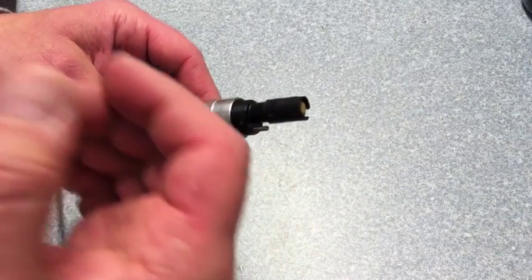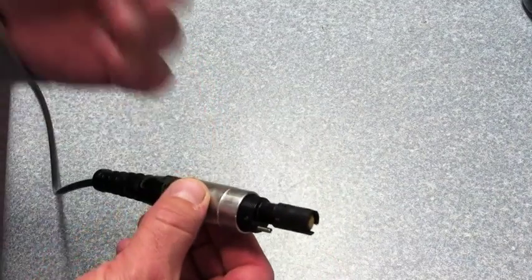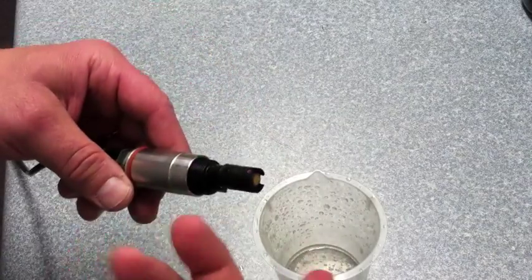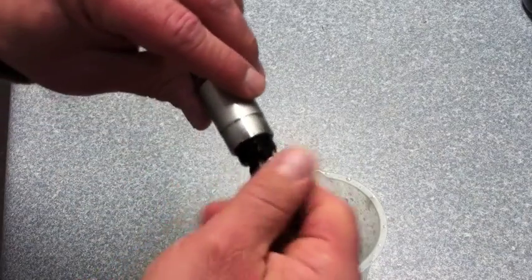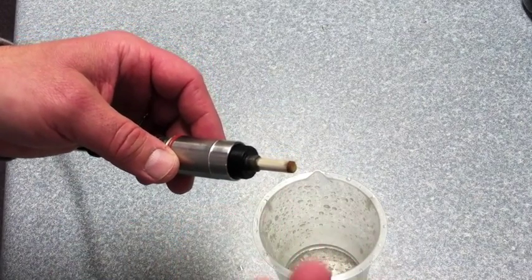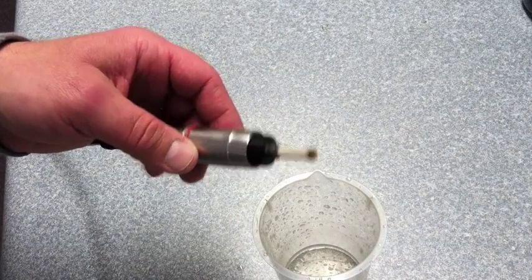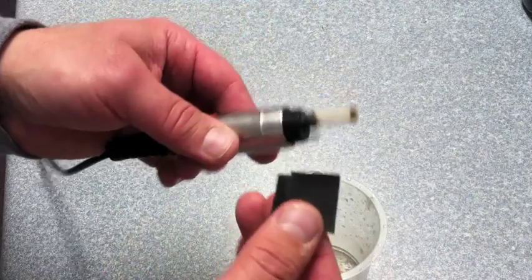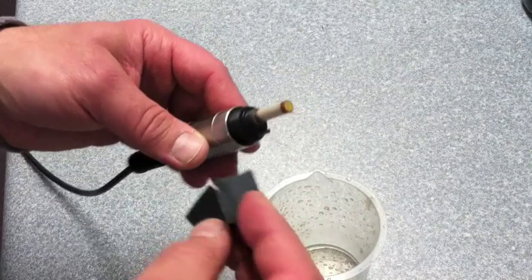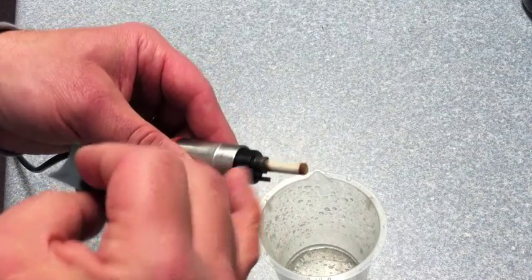Anytime you're not able to calibrate, if it's giving you an error, or if the probe is unstable, that might be an opportunity to take a look at the last time that you did a cap change and maintenance on the probe. We're talking about mechanical maintenance, first of all, and that involves using 400 grit wet sandpaper. And anytime we have the probe off, we're going to use distilled water, and then we're going to take separate sheets of sandpaper to clean both the gold cathode and the silver anode.